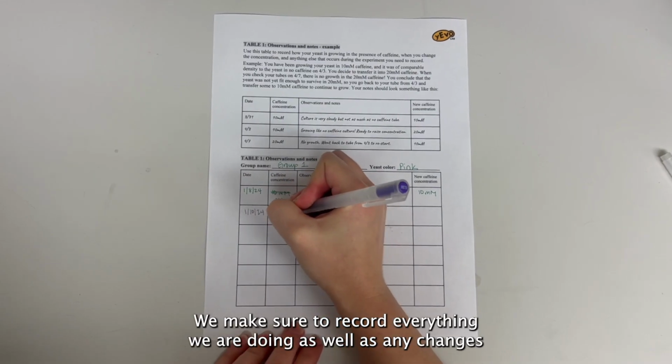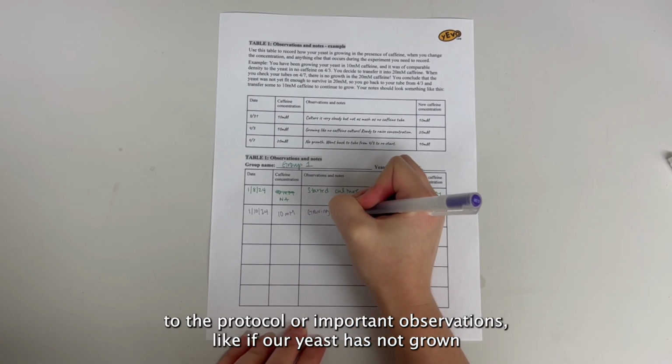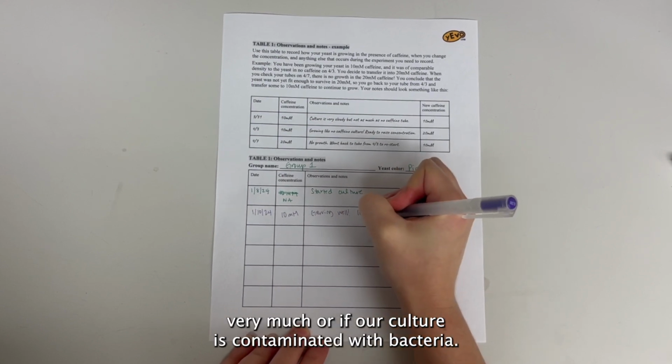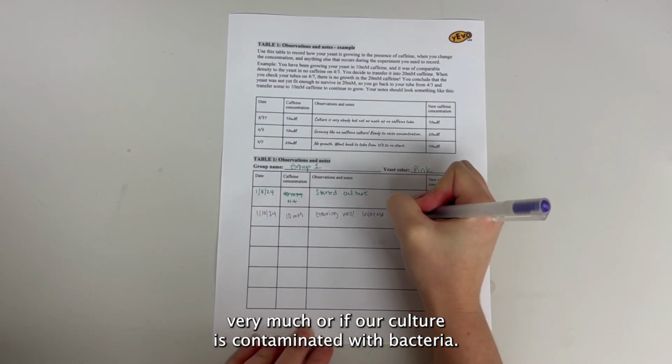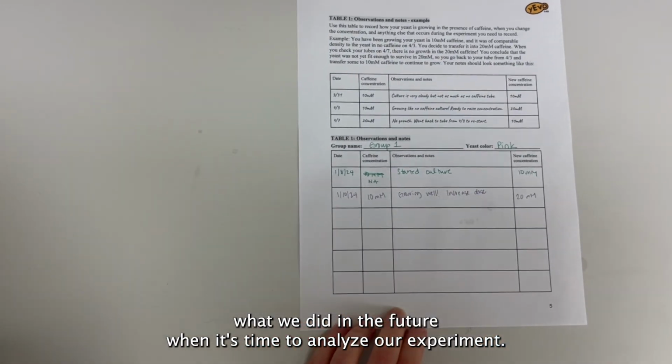We make sure to record everything we are doing, as well as any changes to the protocol or important observations, like if our yeast has not grown very much or if our culture is contaminated with bacteria. This will help us to figure out what we did in the future when it's time to analyze our experiment.